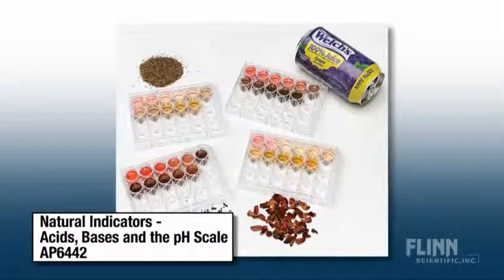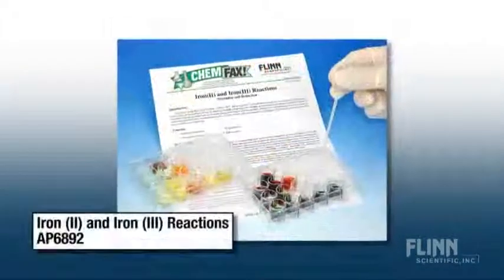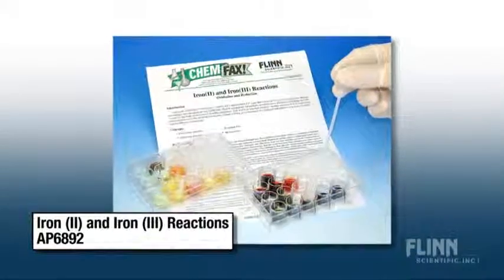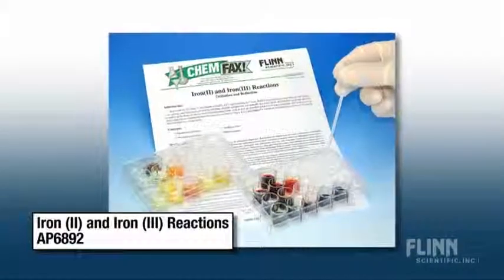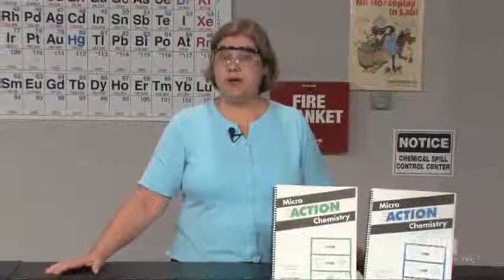Quantitative microscale experiments are also quick, easy, and reproducible. Using calibrated techniques, students can do acid and base titrations, redox titrations, rate law experiments, even equilibrium constants — all with accurate results.